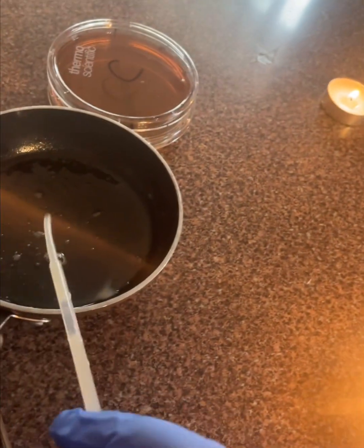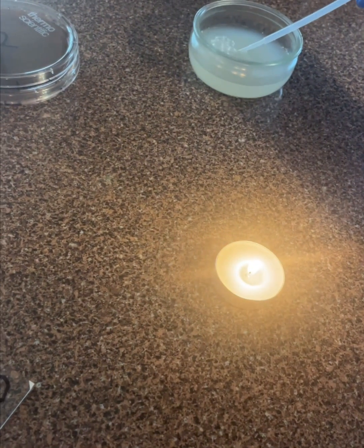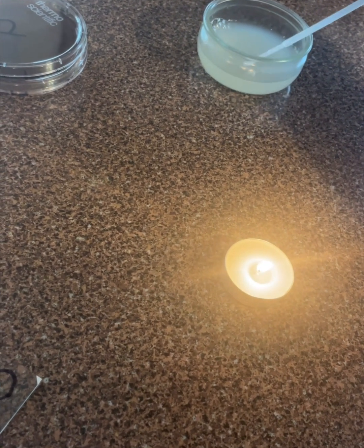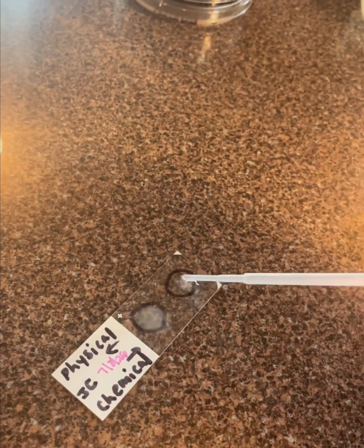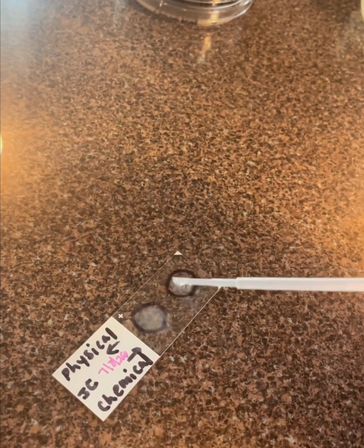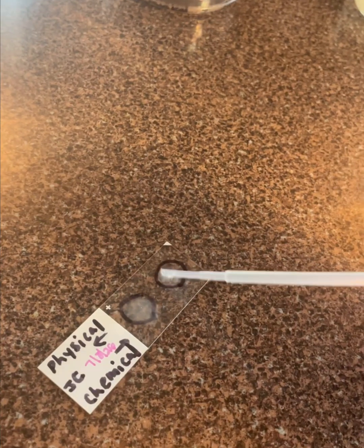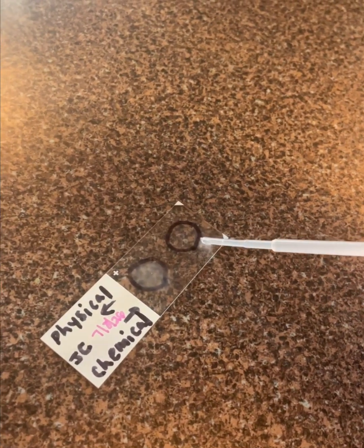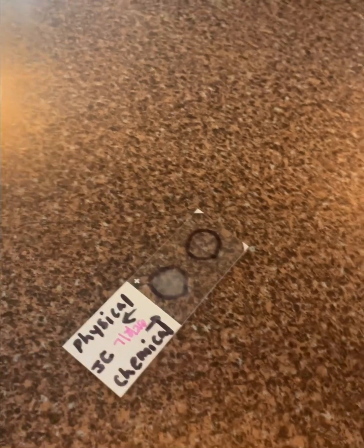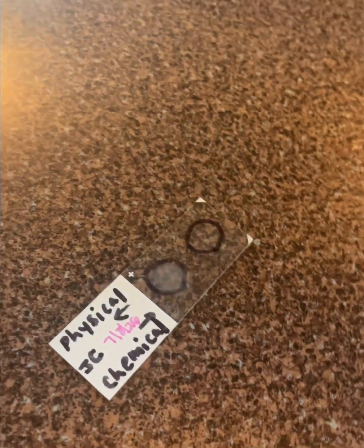And this is using a brand new sterile pipette. And I'm going to get a sample from my chemical. I'm going to add a drop to the slide. My slide has been labeled properly, and I am going to let these completely dry before I gram stain them.